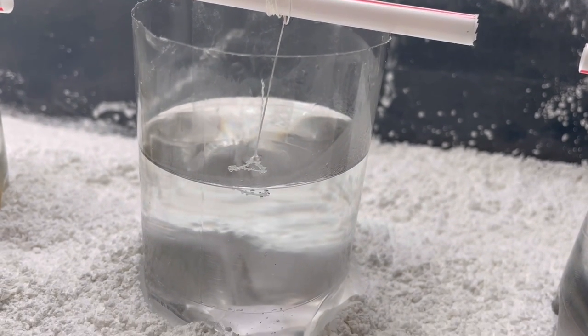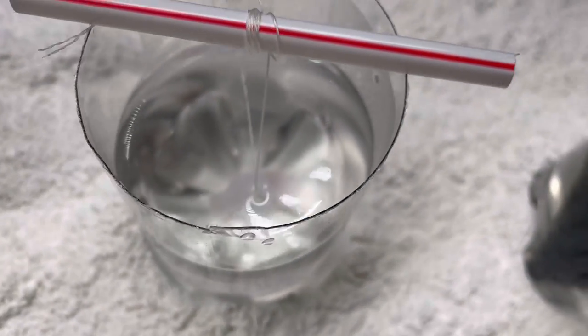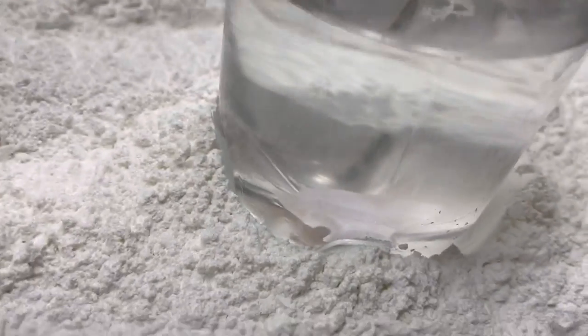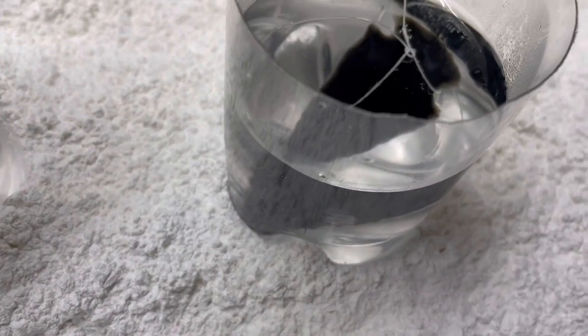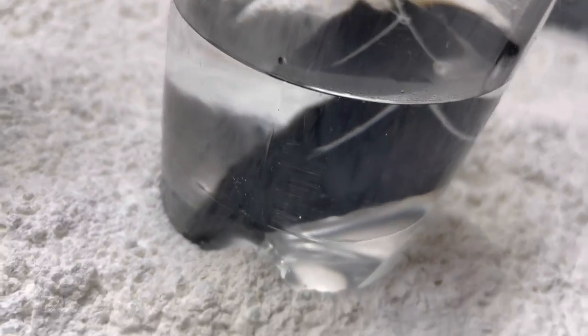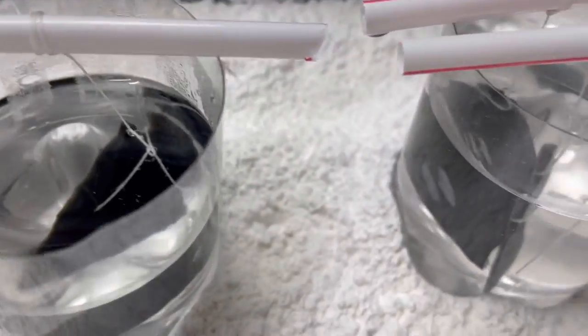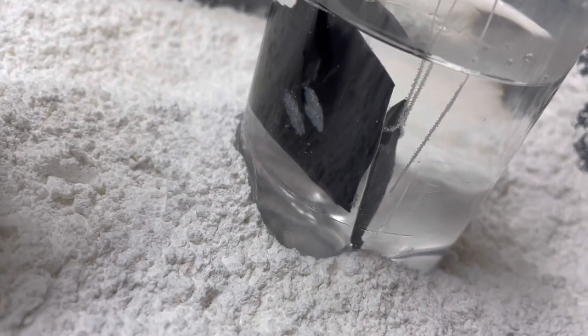Oh, it just came off the string. Yep. This one's looking a lot rounder. These don't look all that different.